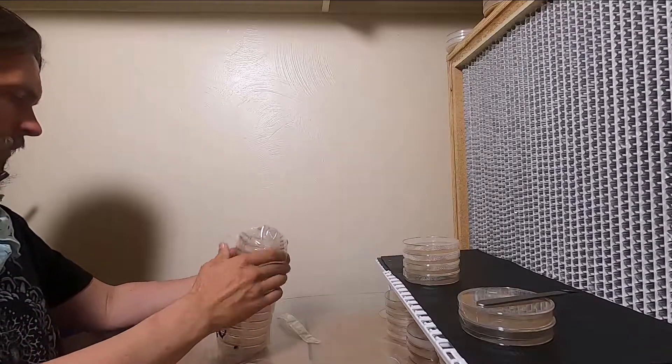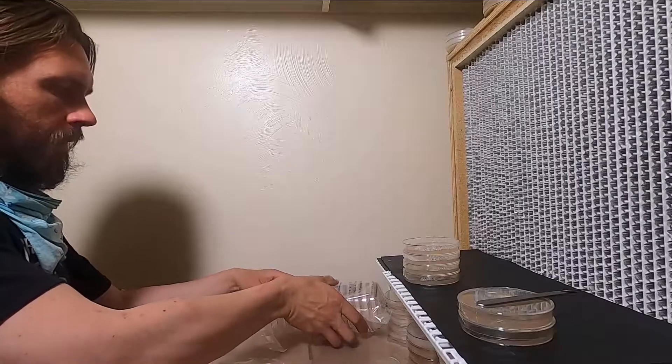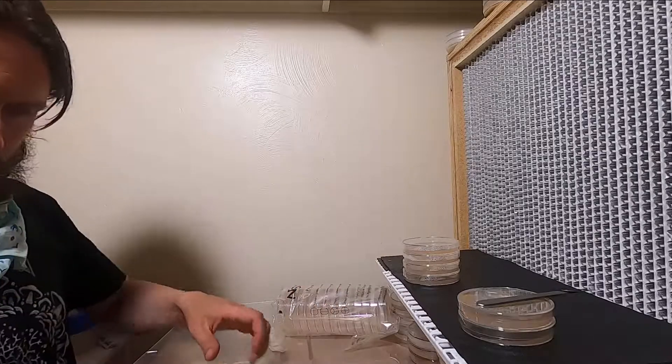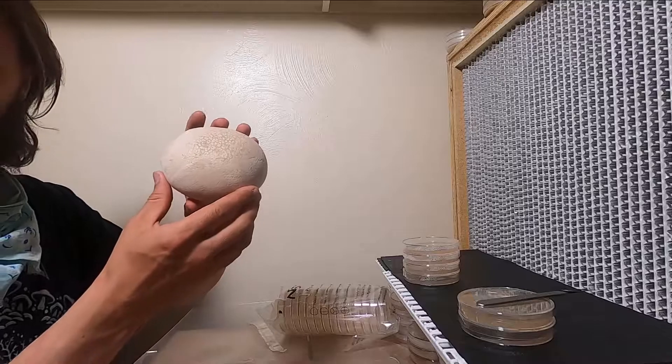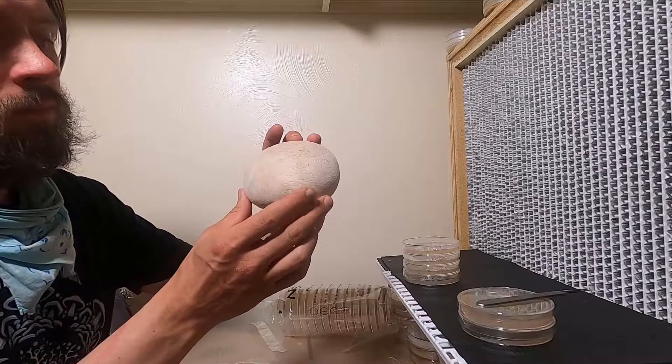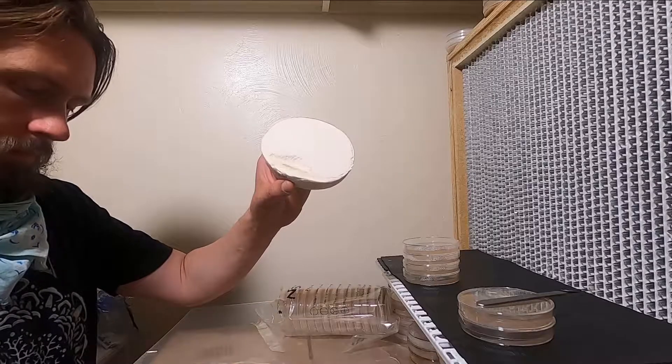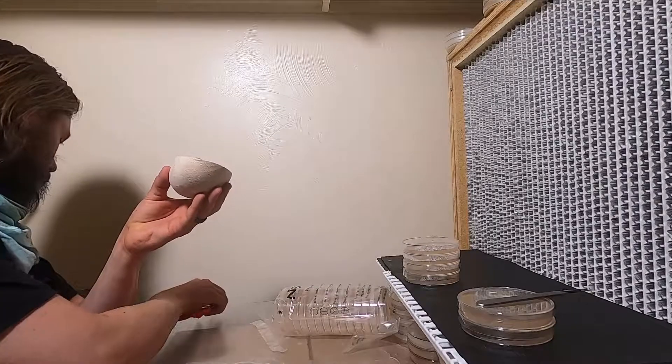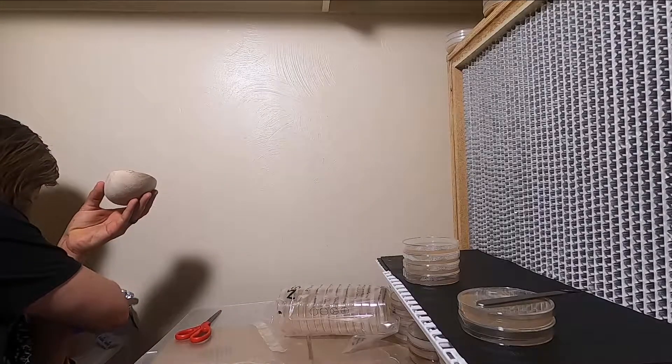I already have washed hands, and I'm folding this over to make sure that no dirt or anything gets inside those plates. Here is half of the Puffball. I already cut it in half just to see what was inside. This is a white Puffball, so it's edible.